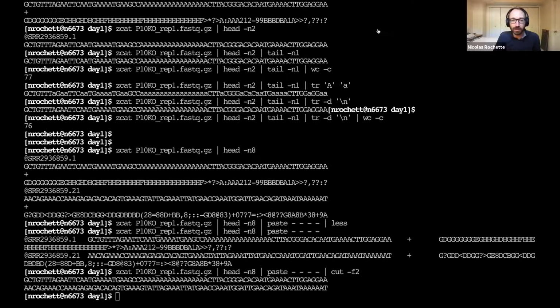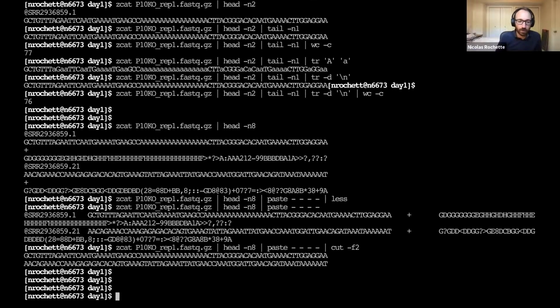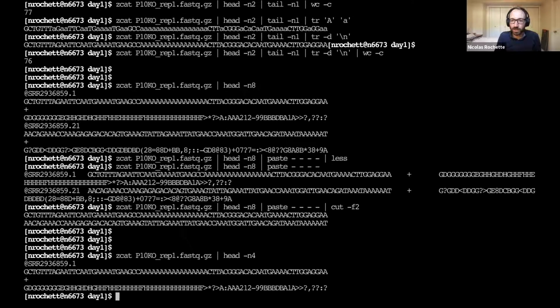Okay, any attempts for the next exercise? So the first base call of the first read, what's the confidence for it? And again, the first read, that's just the first 4 lines. And so what's the Phred score? What's the Phred character, the score character for the read? So for the first base, that would be this G here. And so the quality that comes with the G, which character is it, and then which score does that correspond to?